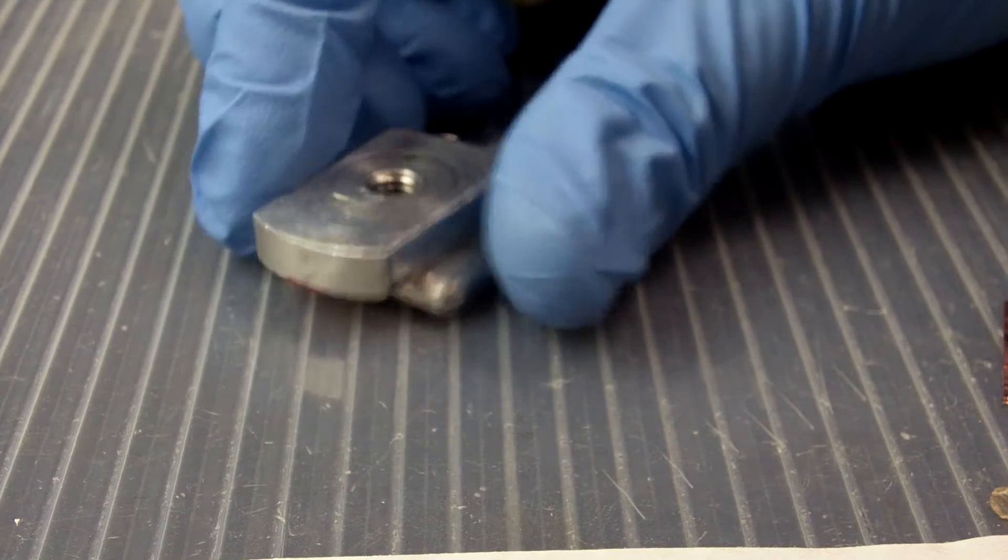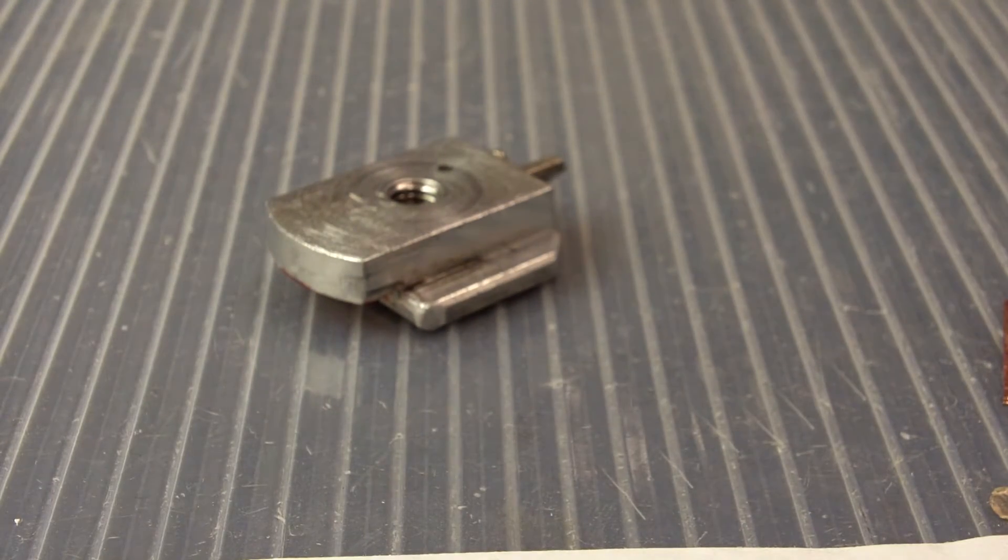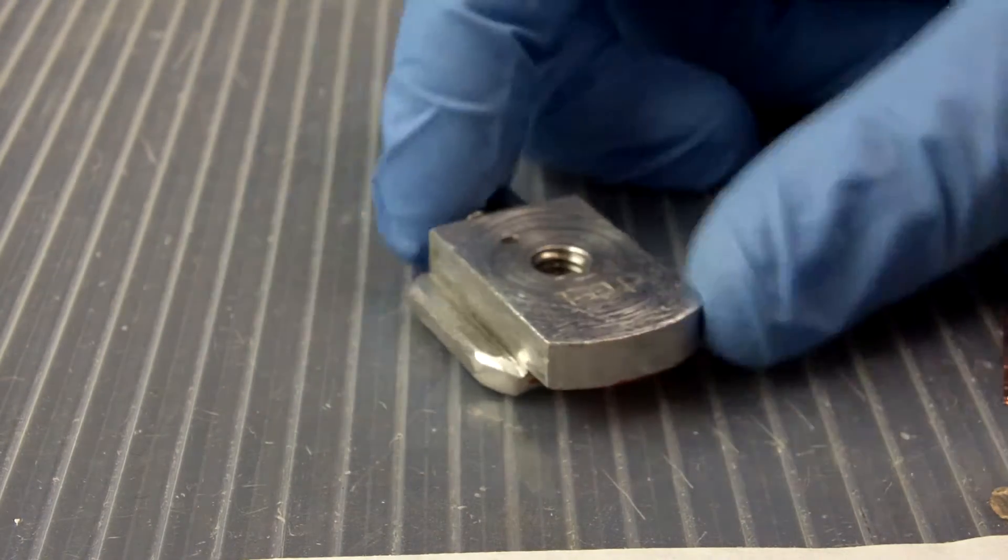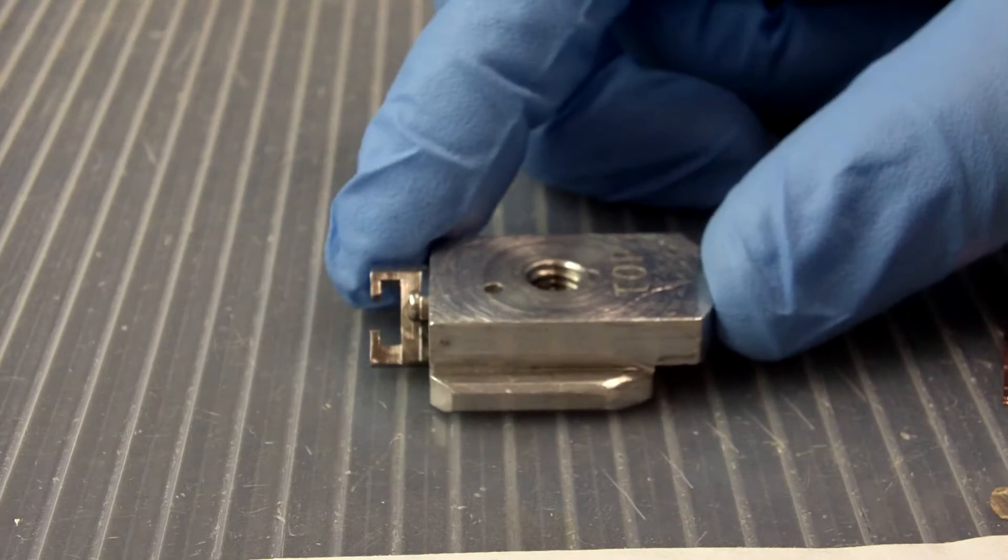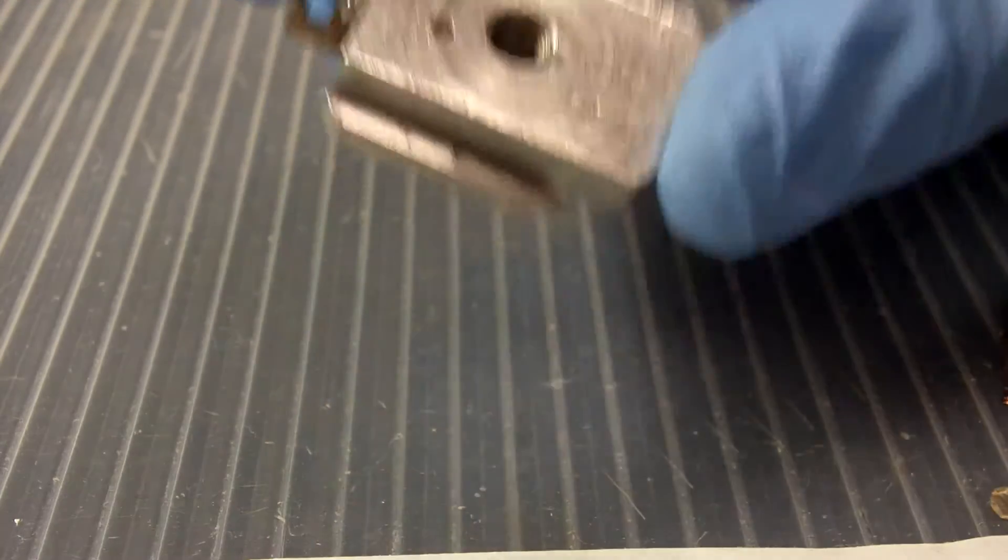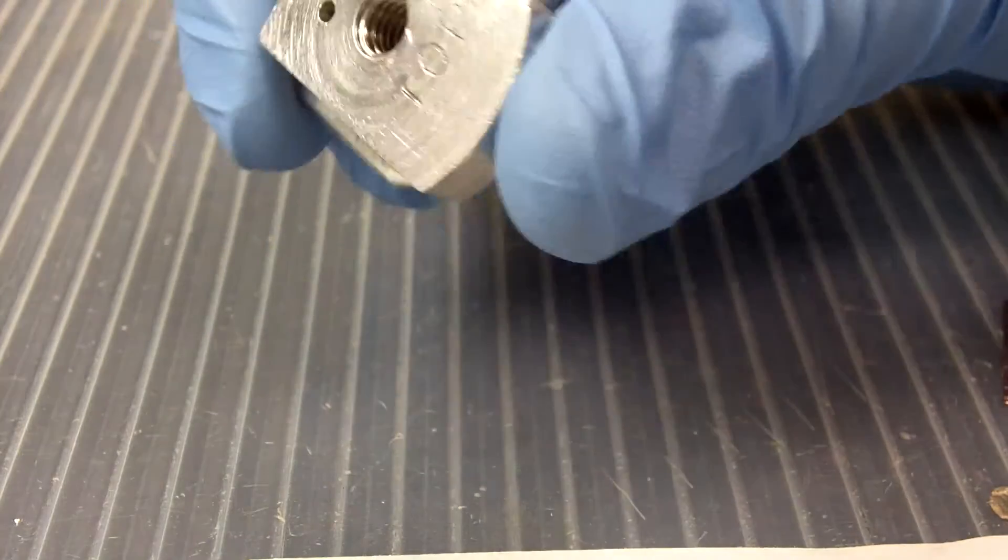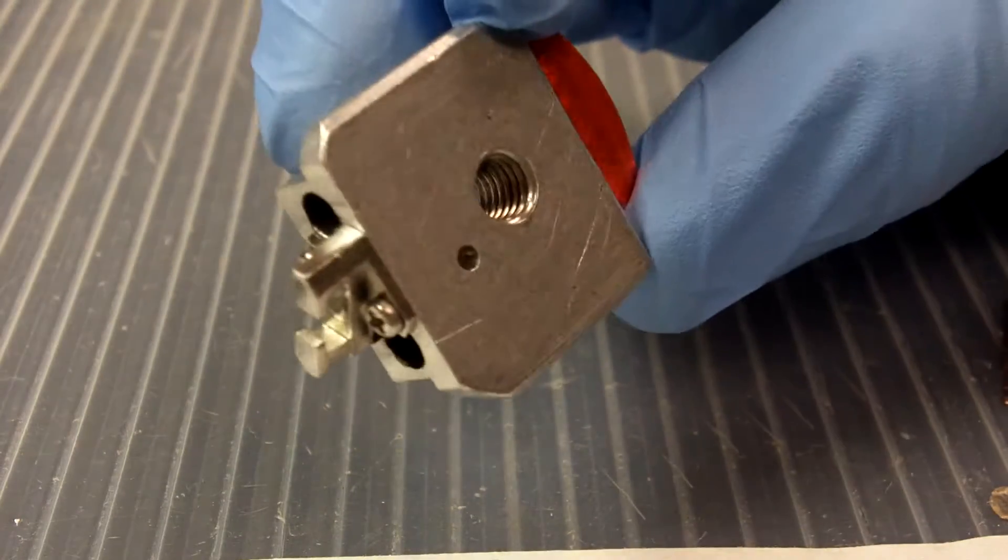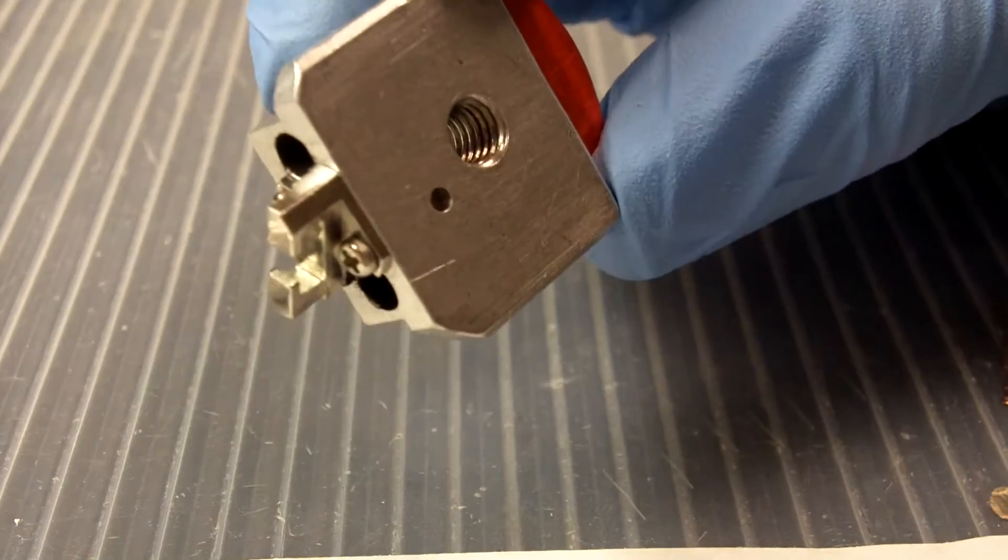Let's step into the Wayback Machine for a minute and take a look at this old base that came with the older Hitachi 4500, 4700, and 4800. It had one small problem. The threads for the screw here in the middle went all the way through from the front all the way straight out the back. So why is that bad?